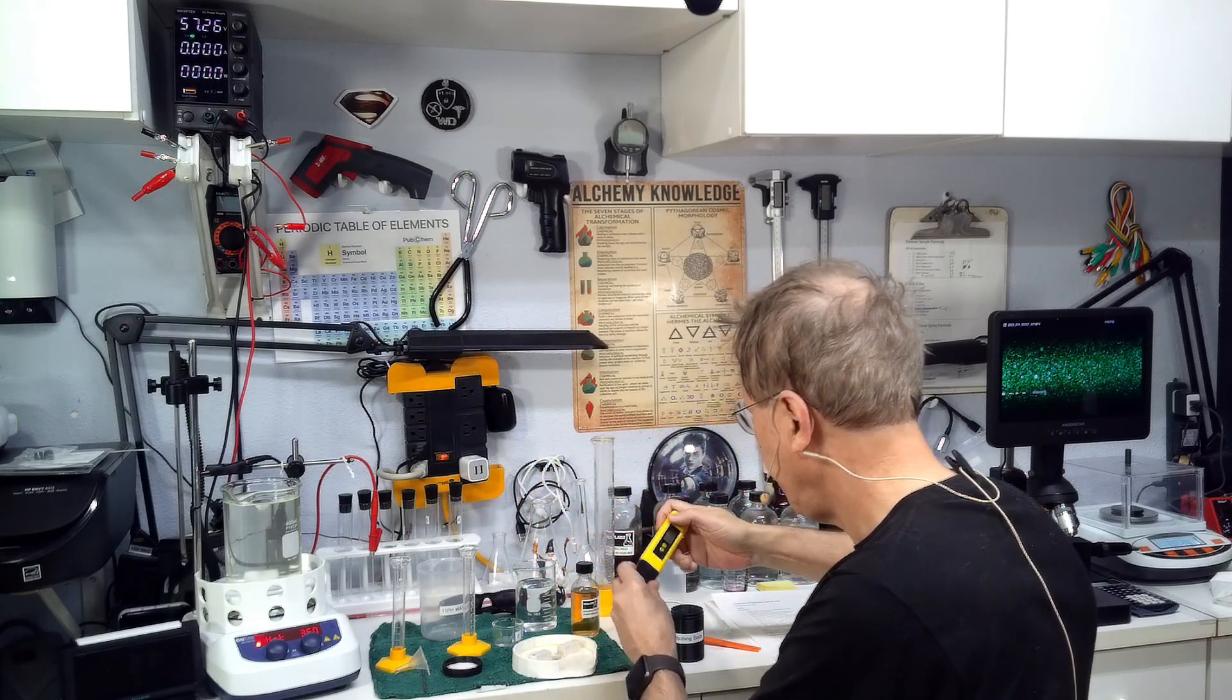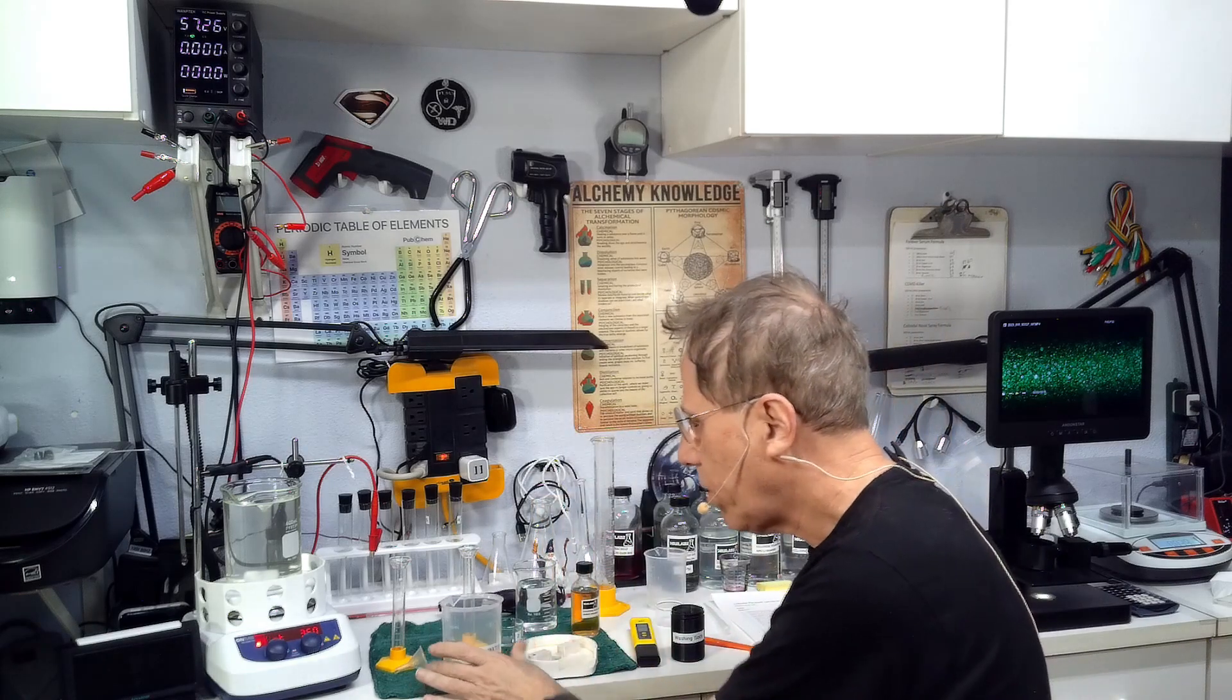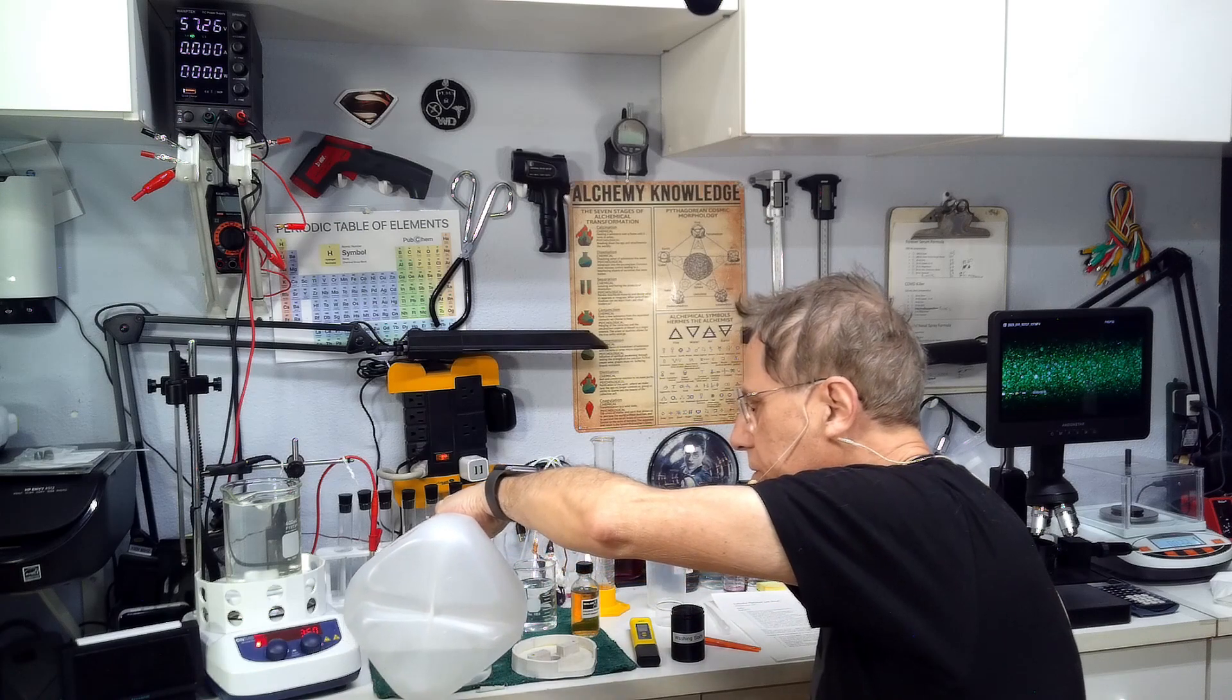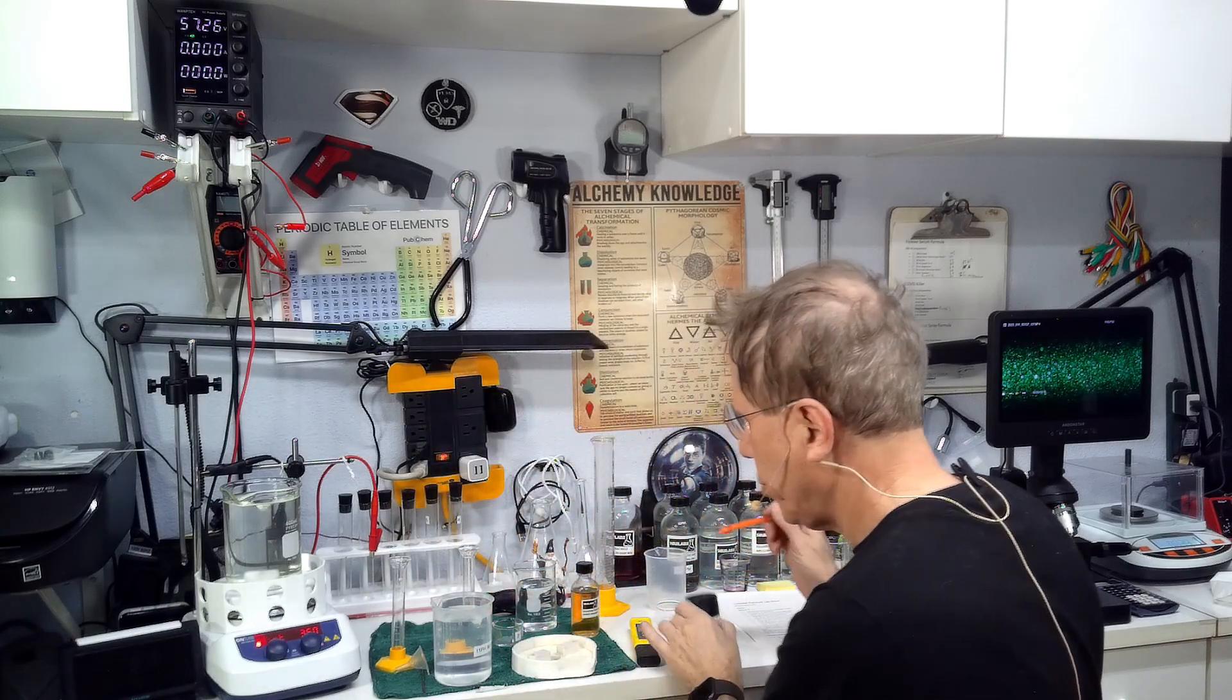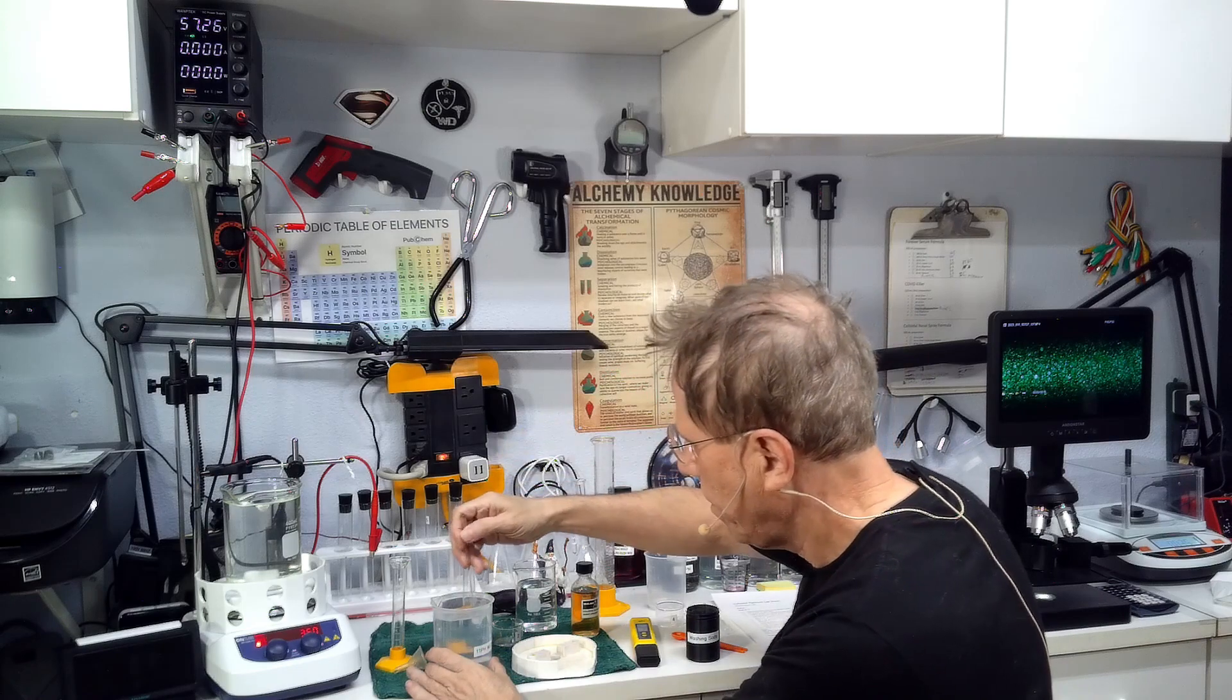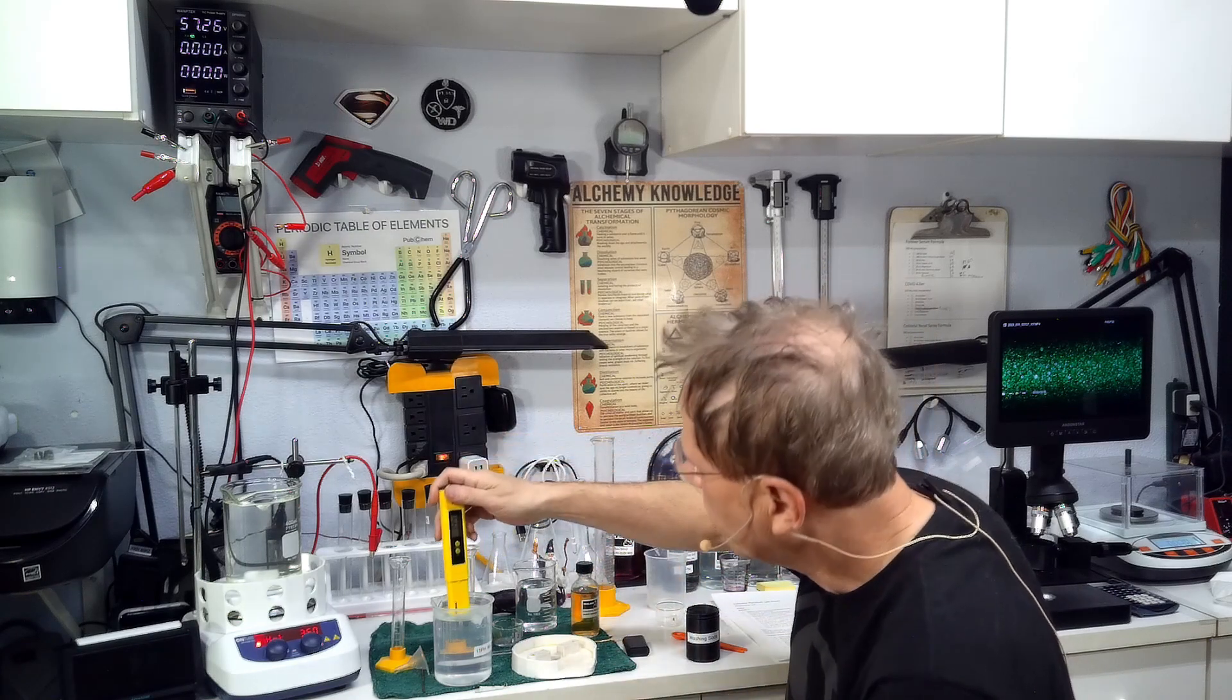As this stuff gets hot because it's going to be at 80 degrees C, you're going to need to add more water. You need to fill a beaker with distilled water. You're going to take a little bit of your washing soda, a sixteenth of a teaspoon, and mix this up. You want to use as little washing soda as you can get away with.